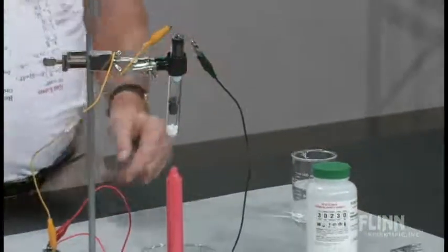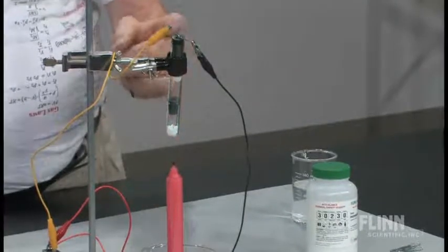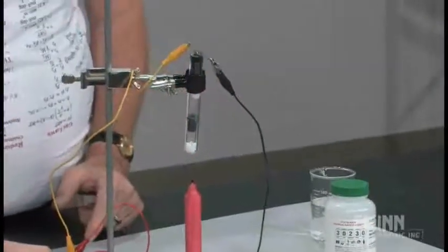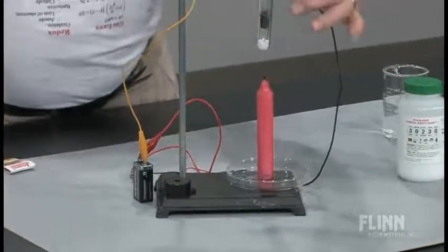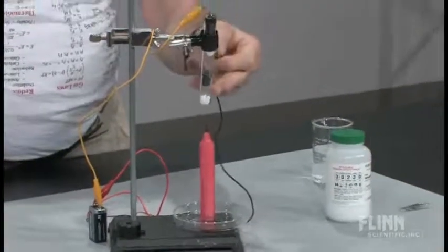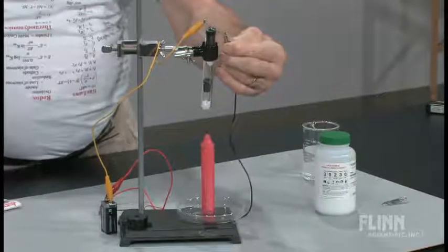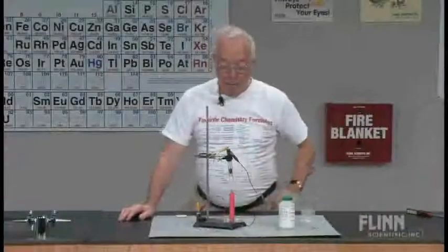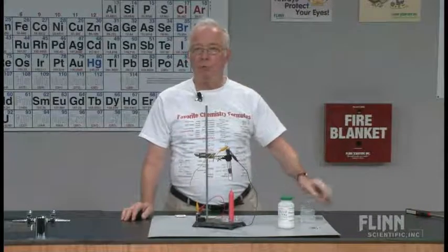For example, there are potassium hydroxide pellets here. This is a buzzer, a 9-volt battery. Now let's show you that the buzzer — if we short out this system that way, the buzzer works. And now there's no connection. The two leads here are not connected to each other. If we put those two leads into this solution, the buzzer would go off.